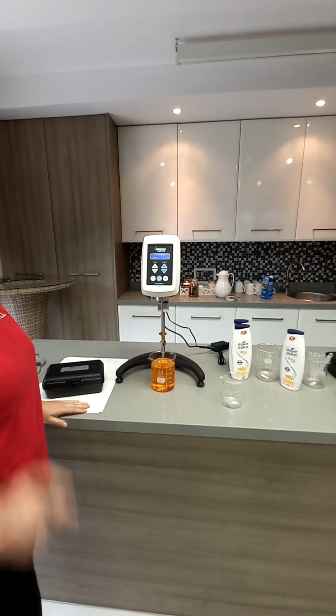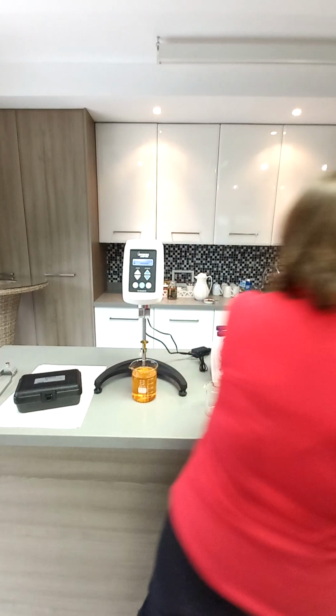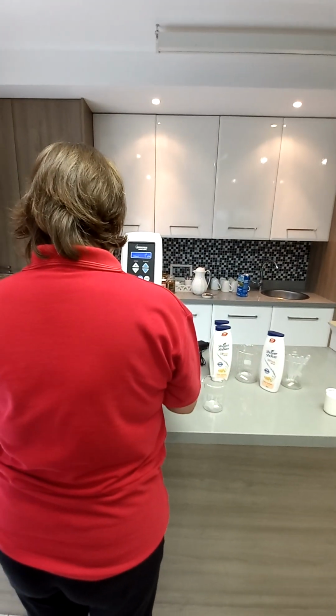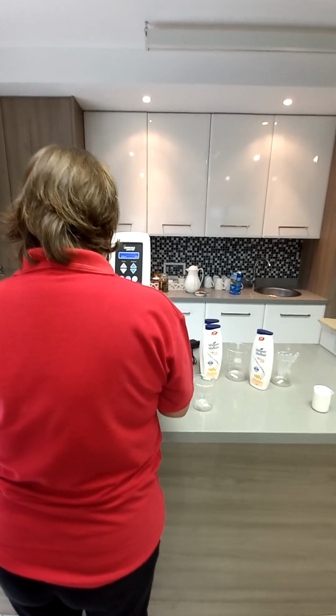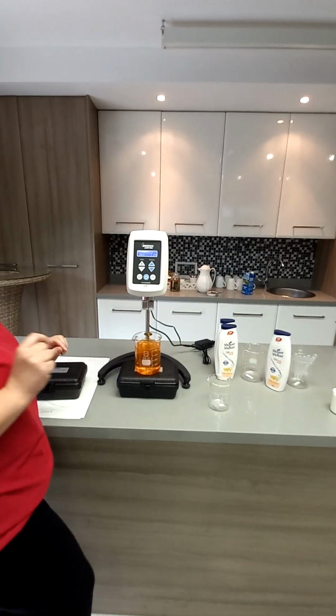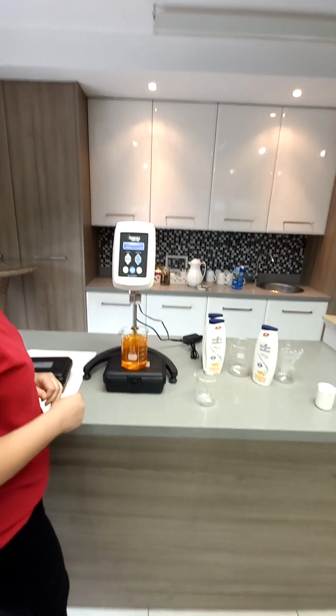Do you have a book? Or what about this little box? We have helipath spindles. I just wanted to raise the sample a bit. It doesn't go down. I need a book. Put it in the middle one there.